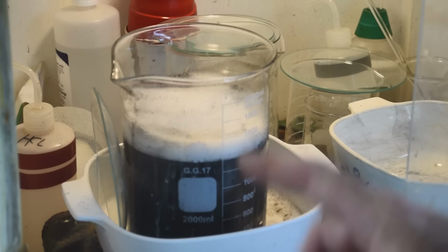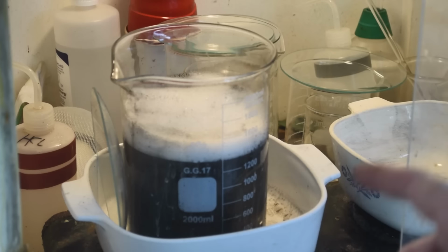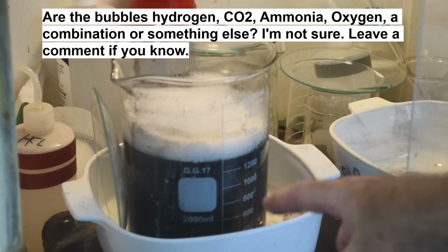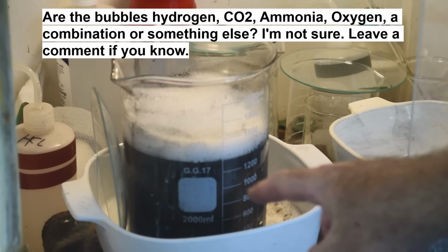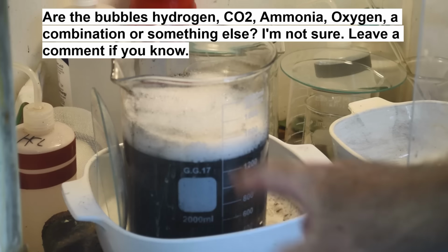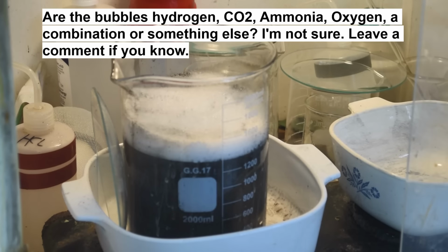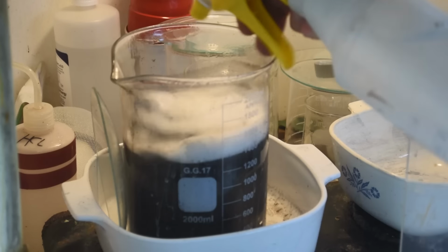expecting it to happen. It didn't happen immediately after putting ammonium formate solution in. It happened later. There's still foam being created. There's lots of bubbles coming up, even though the heat's off and this stuff's cooling down. And it's making it very foamy. I've had to knock the foam down a few times with a water spray.